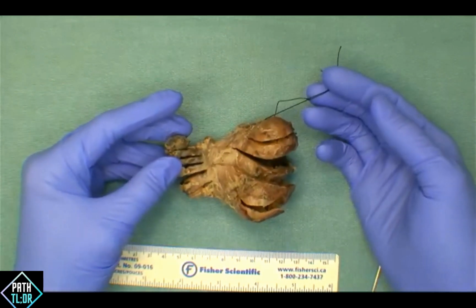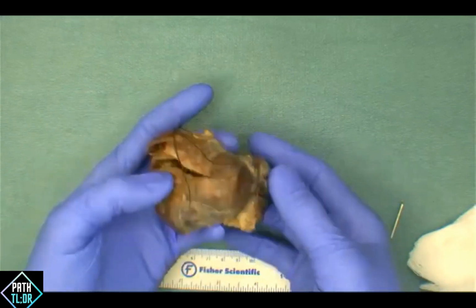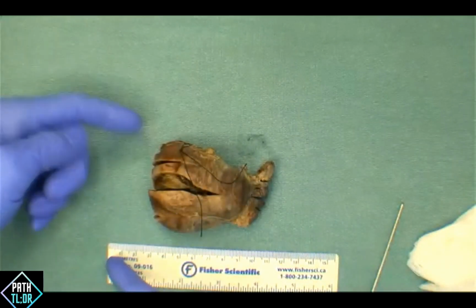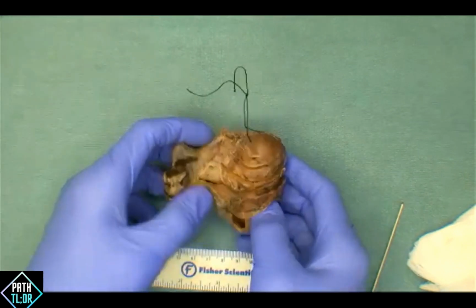We find often with the thyroid glands there is a flip between right and left, depending on if you're looking at it from the patient standpoint or if somebody in the OR is actually putting the stitch on the left side as opposed to the patient's left side and the left lobe of the thyroid. And then do some cuts into the specimen to allow fixation.